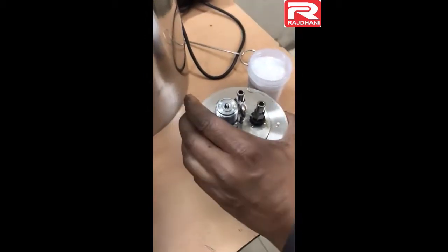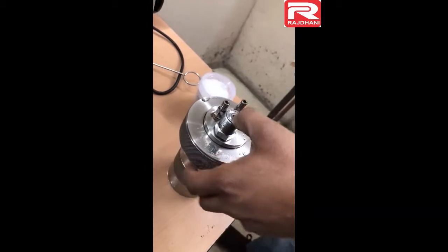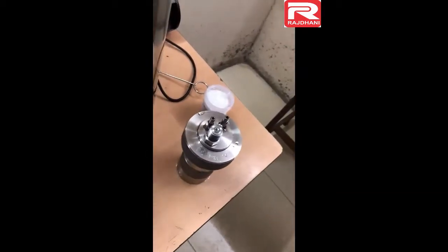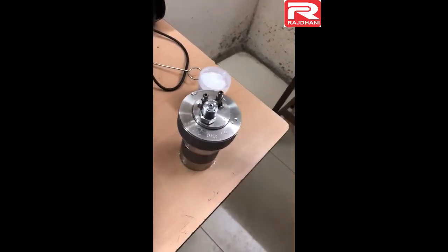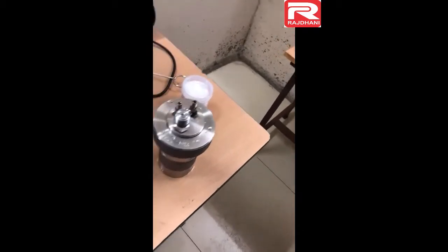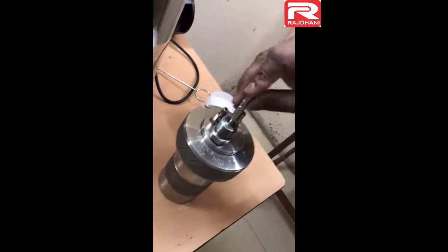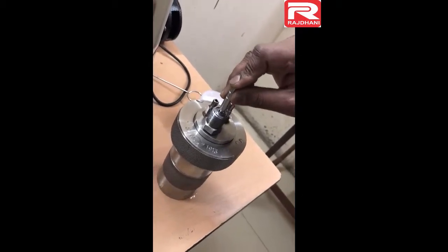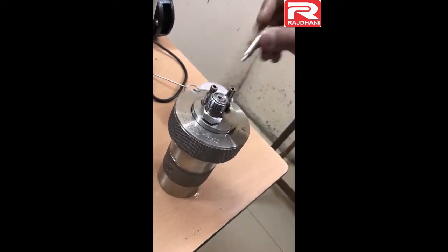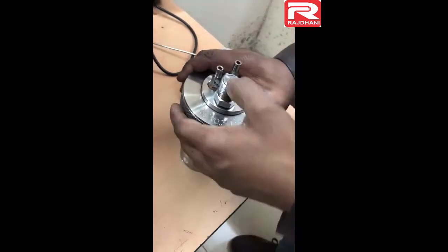Now to open the bomb — pressing it will not open it directly. First we have to release the oxygen using the gas-releasing pin found in the accessory box. Only after the release of oxygen can the bomb be opened; otherwise it will not open.